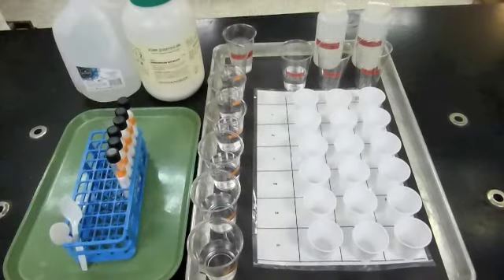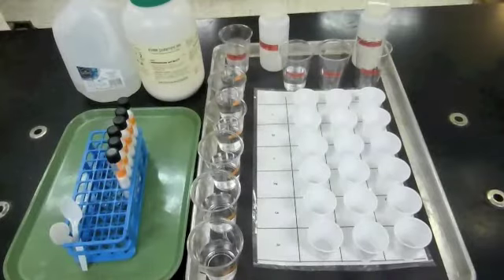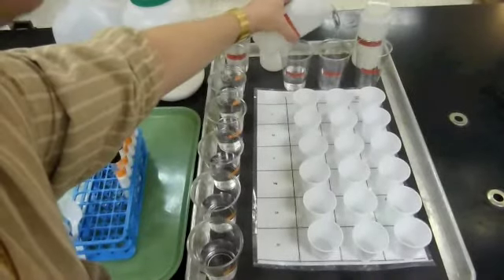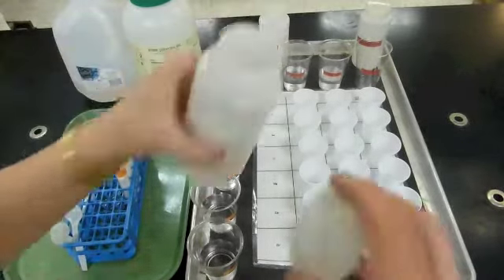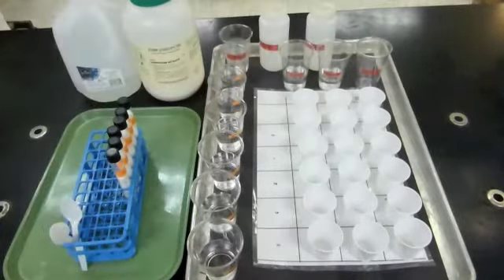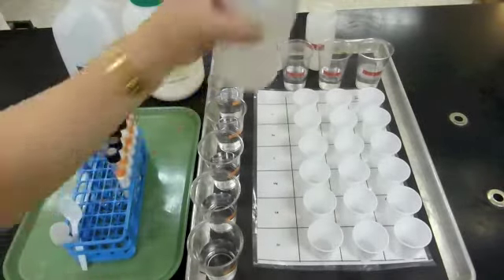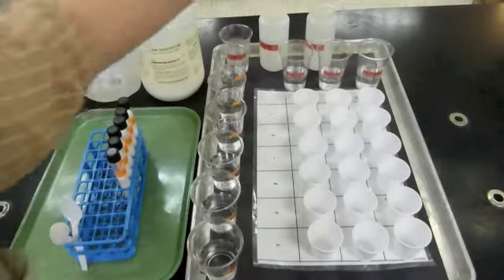The chloride is a clear, colorless solution. The carbonate, when you pour this one out, you'll see is a clear, colorless solution. And the phosphate, when you pour that one halfway into a cup, you'll see that this one is also a clear, colorless solution. So we're starting with substances that are all soluble in water.